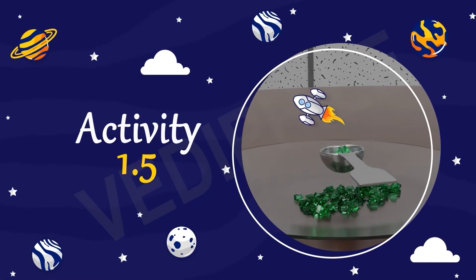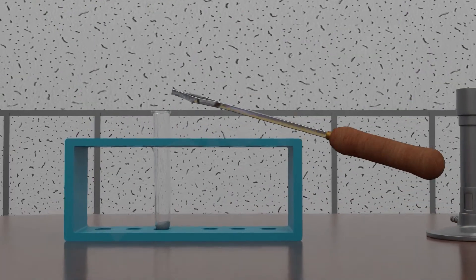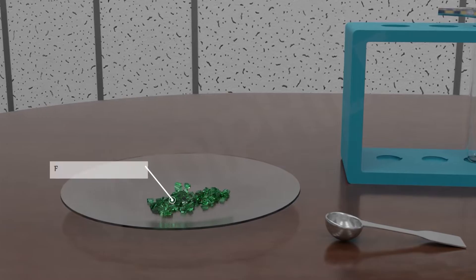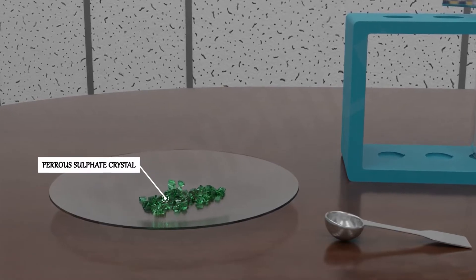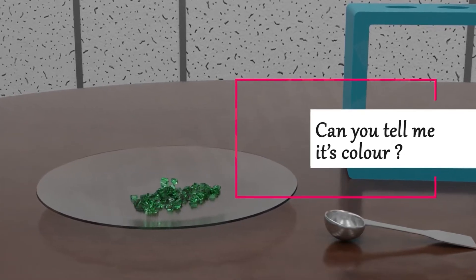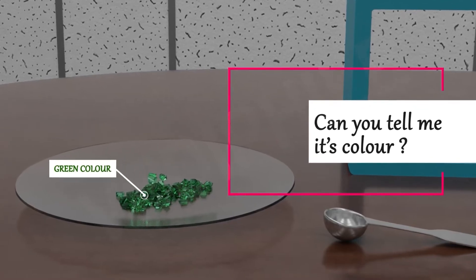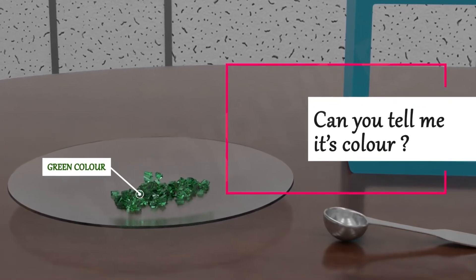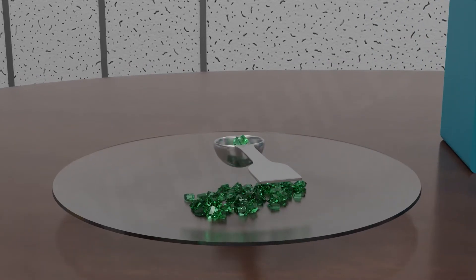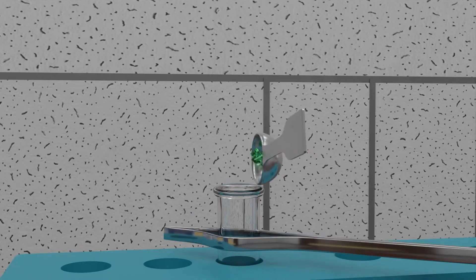Activity 1.5. Pick up the boiling tube. Can you see the ferrous sulphate crystals? Can you tell me its color? Yes, it is green. Now add 2 grams of ferrous sulphate crystals in a dry boiling tube.